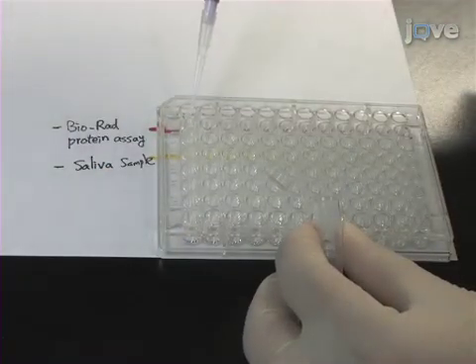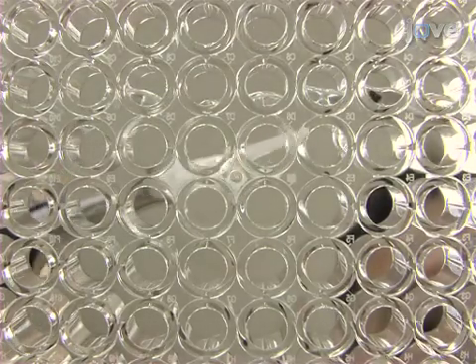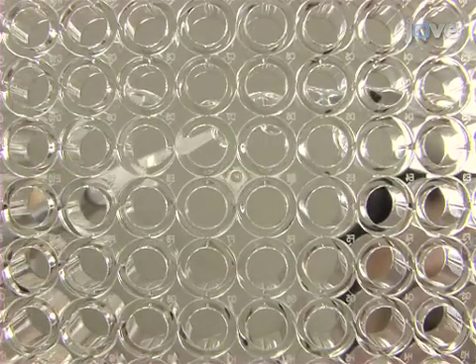Next, determine the protein concentrations. Prepare 1 microgram per microliter of the saliva protein samples for nano-LC mass spectrometry analysis.